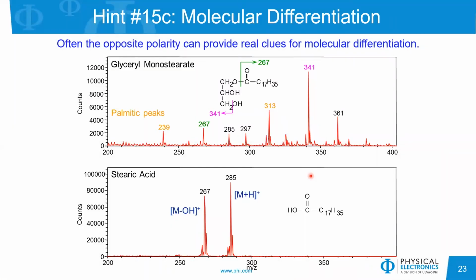So if we look at higher mass to charge ratio, what we can see is that glycerol monostearate has a very different fragmentation pattern than what we see for stearic acid. So this is the positive ion polarity. If you remember, for stearic acid in the negative ion polarity, we see the M-H at 283. In positive ion, we see the M+H at 285. And then we see the M-OH, still a positive ion, at 267. But for the glycerol monostearate, we see a very different fragmentation pattern. So this would distinguish between a combination of stearic acid and palmitic acid, and gives us very clear evidence here that we're looking at glycerol monostearate. So digging deeper into the spectral information can give a lot of information and help us choose what we're looking at.